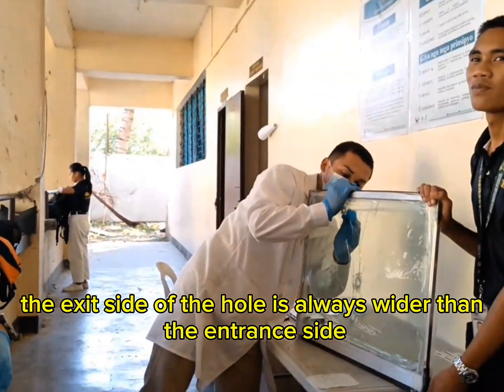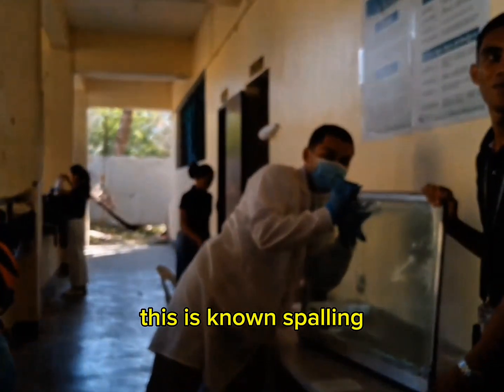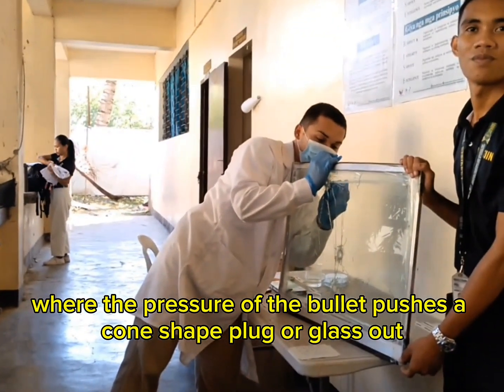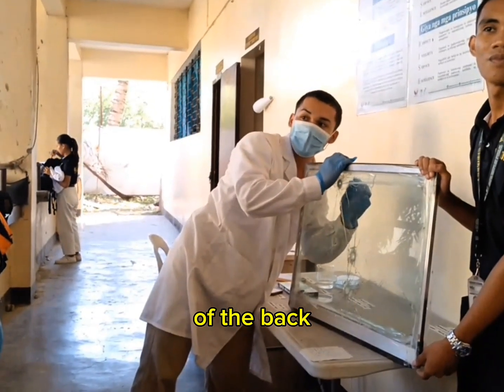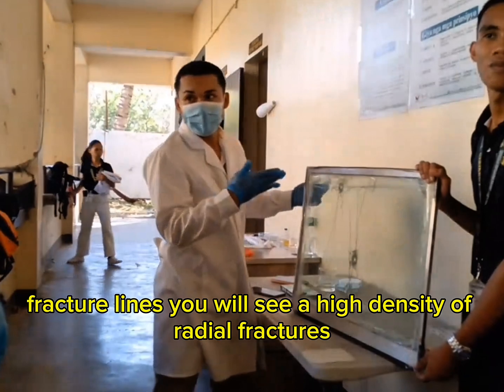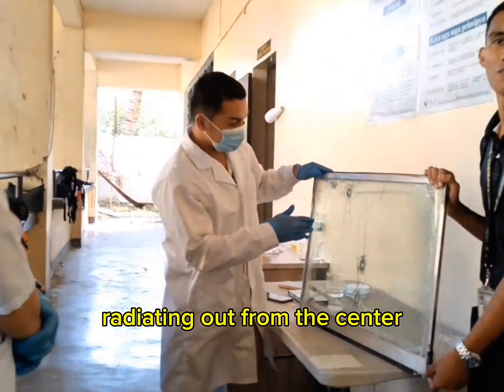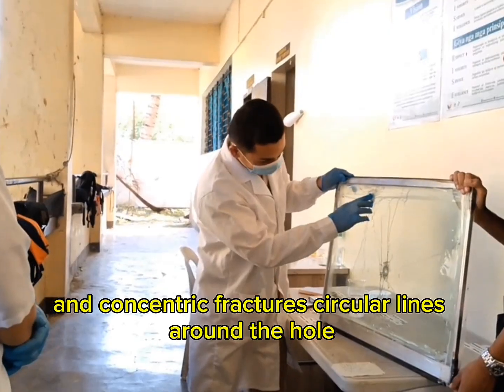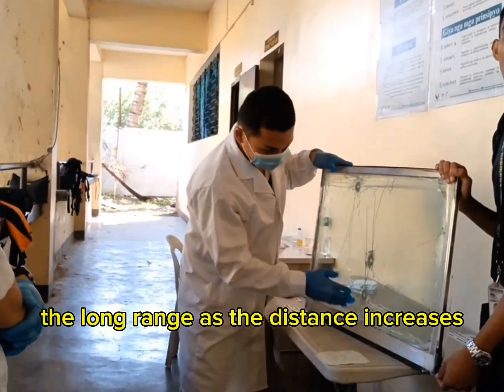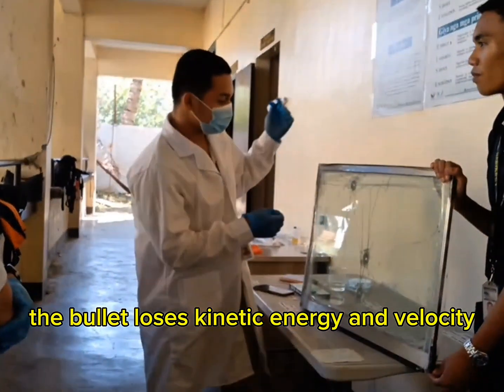The exit side of the hole is always wider than the entrance side. This is known as spalling, where the pressure of the bullet pushes a cone-shaped plug of glass out of the back. Fracture lines: you will see a high density of radial fractures radiating out from the center, and concentric fractures, circular lines around the hole.